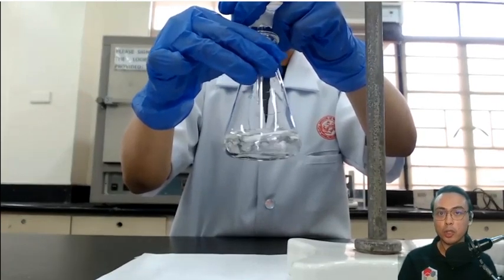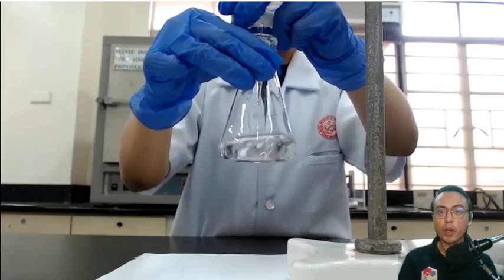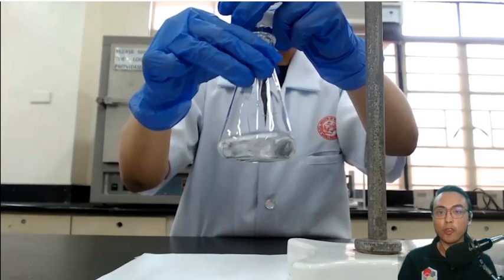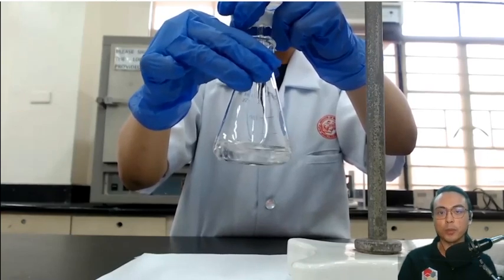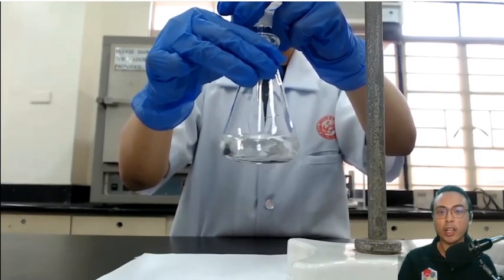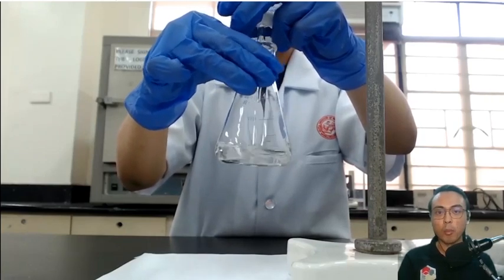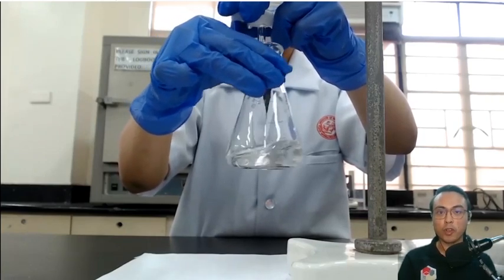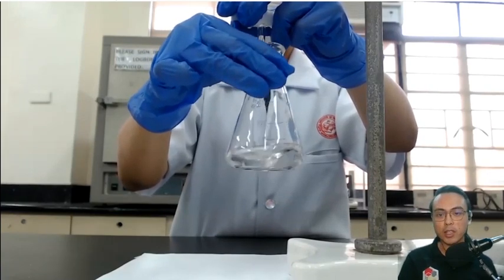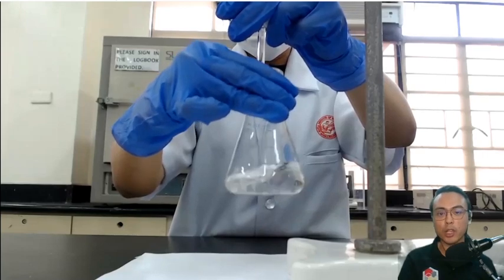Without indicators this titration would not be possible. Notice that she is slowly adding drops of the titrant to your analyte — the titrant is placed in the burette, which contains the sodium hydroxide solution of known concentration, and in the Erlenmeyer flask is your analyte. You will see later that as she adds more drops of the titrant there will be a change in color in the flask. Let's fast-forward through the titration.